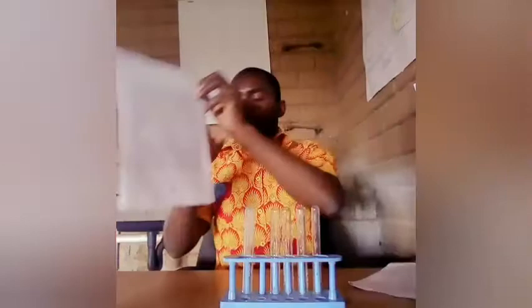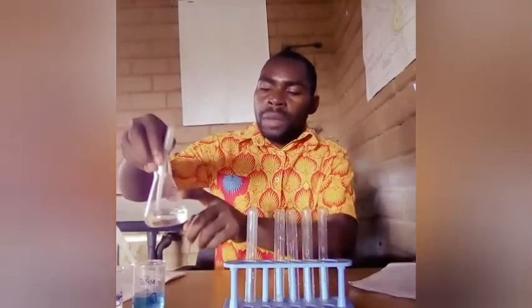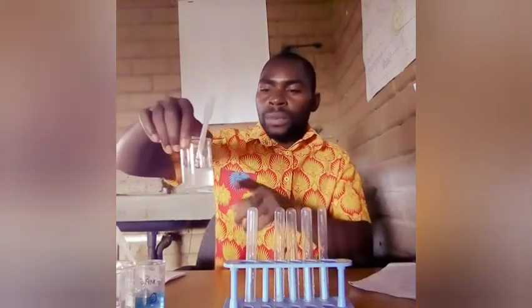In this experiment, the apparatus that I'm going to use consists of these 4 test tubes. Then I've got different solutions. This is silver nitrate. Then this is solution Q, which happens to be copper 2 sulfate. Then I have this, aqueous ammonia, of course. Then there is aqueous sodium hydroxide solution, and then there is also this barium nitrate.